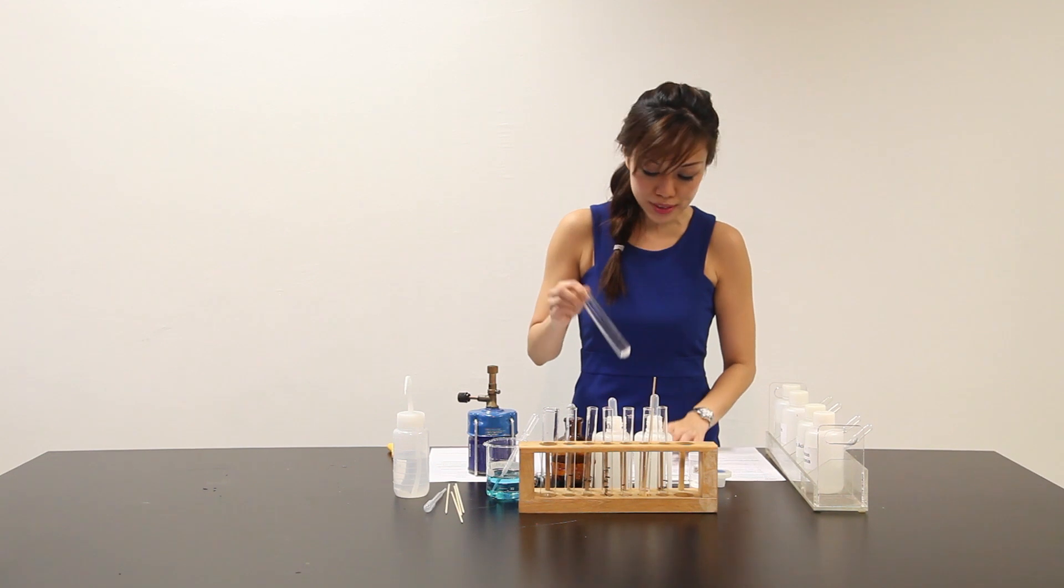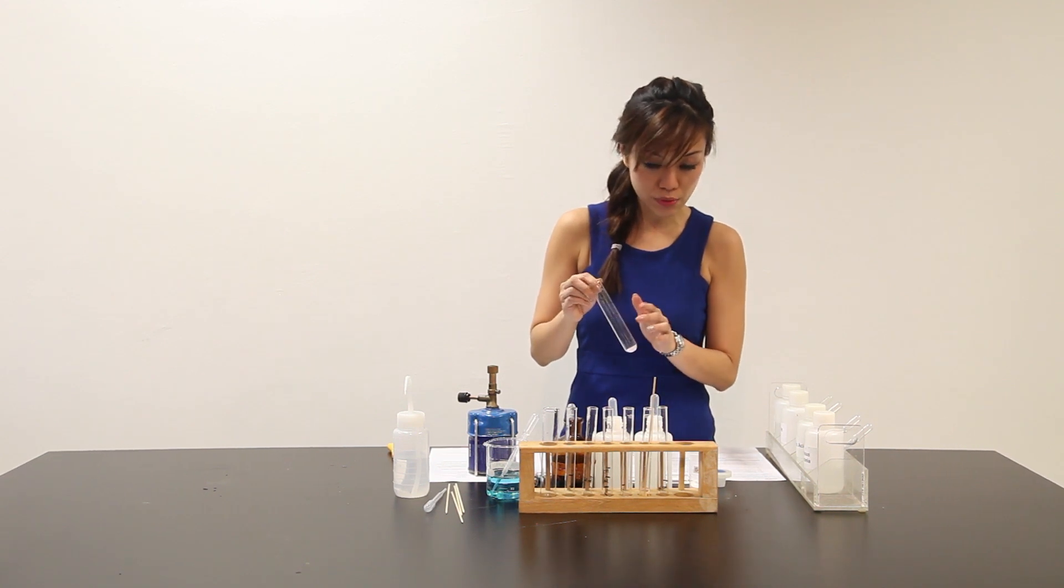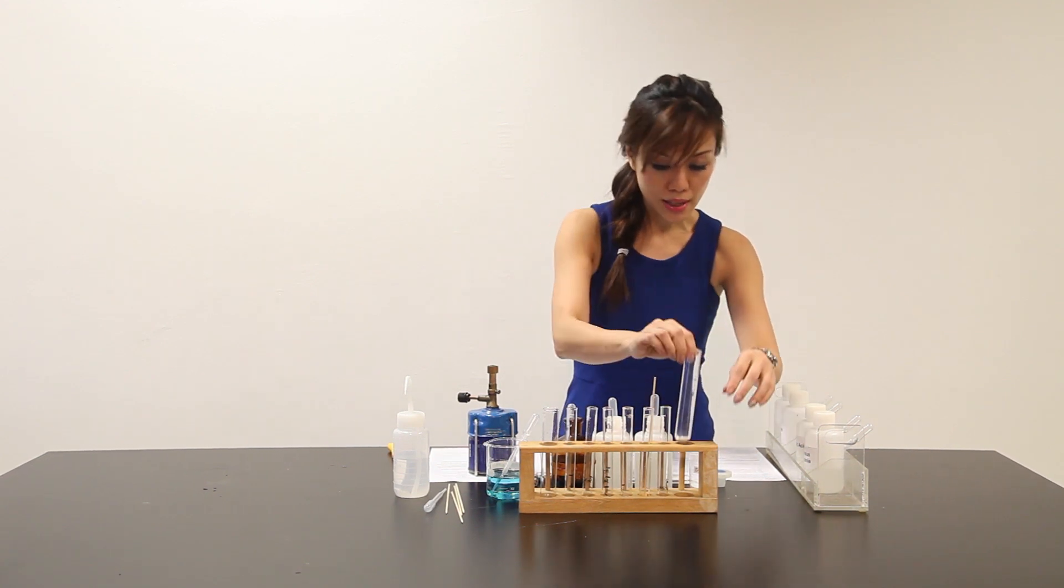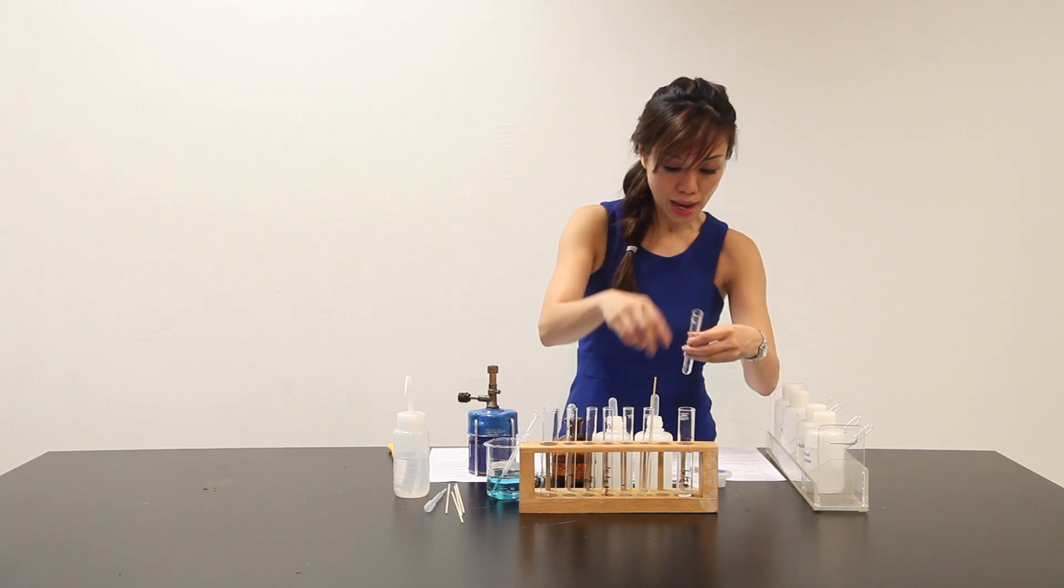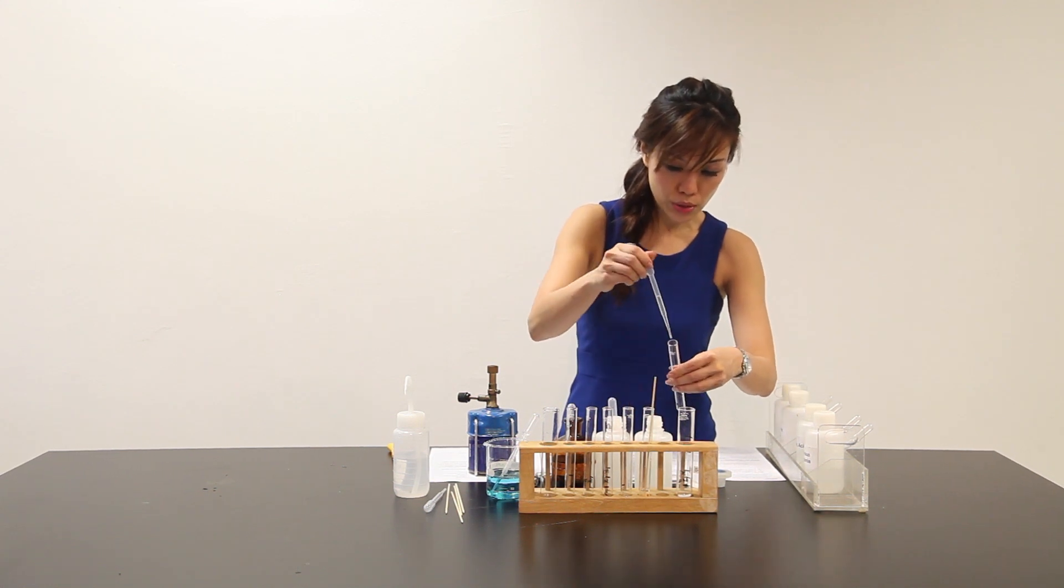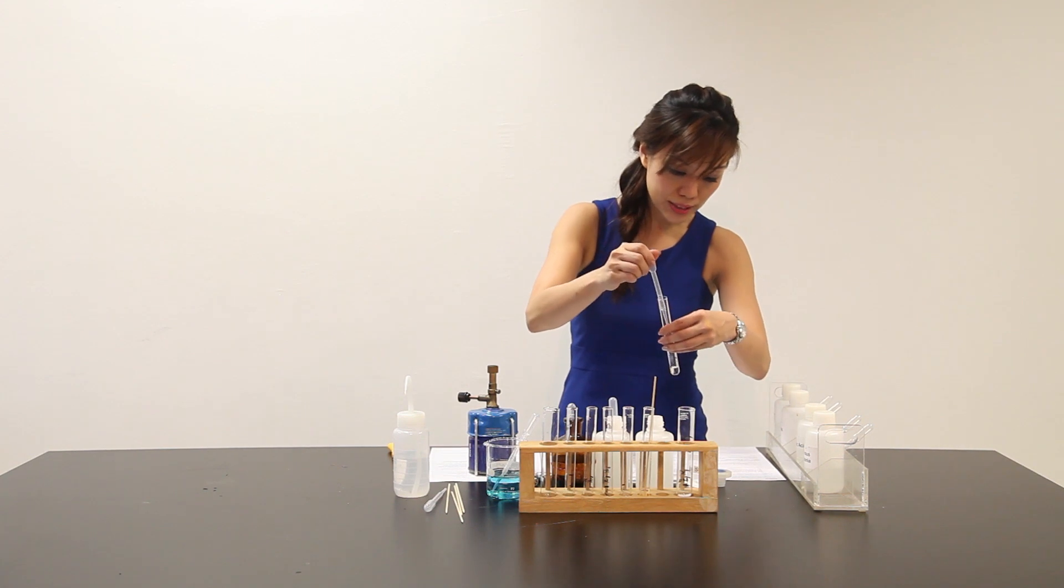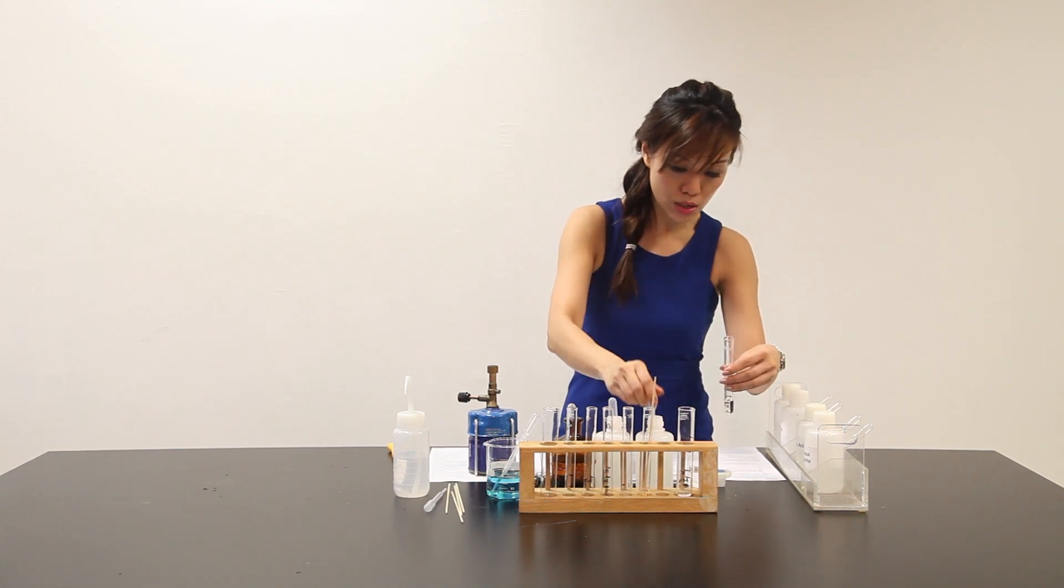I'm going to test and withdraw several portions of gases involved here into another test tube that's filled with lime water. When you use lime water, we can tell that you are actually testing for the presence of CO2.